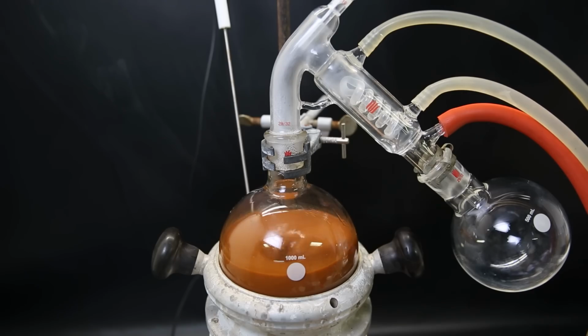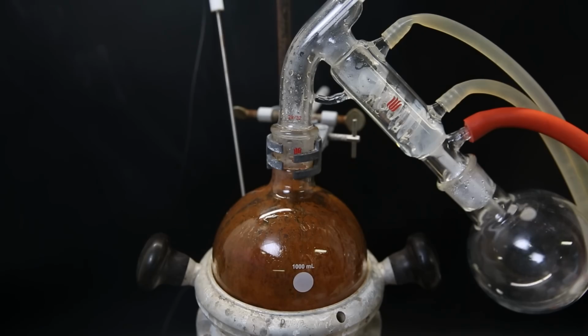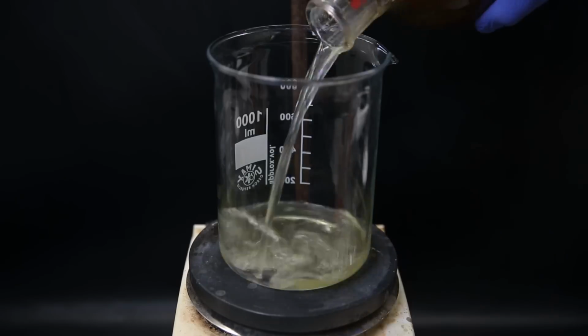I then set this mixture up for short path vacuum distillation, to first remove all of the water, methanol, and formaldehyde. When it is mostly gone, we see a white solid in the condenser, which is probably from water steam distilling the product. What is left behind is just a black sludge, so I add some DCM to wash out the product. I did that several times, and it should have taken up the product.